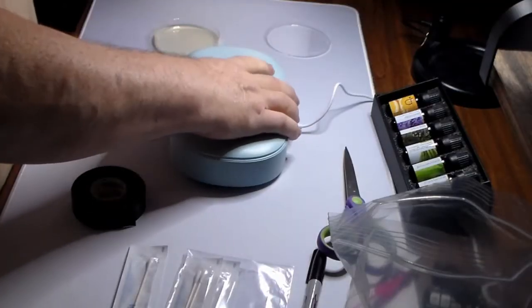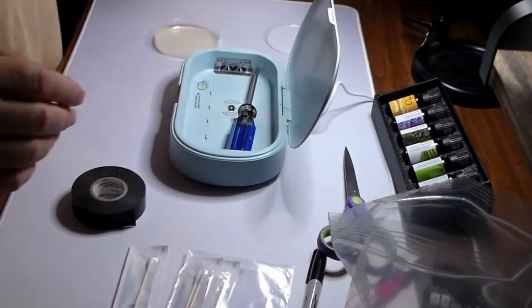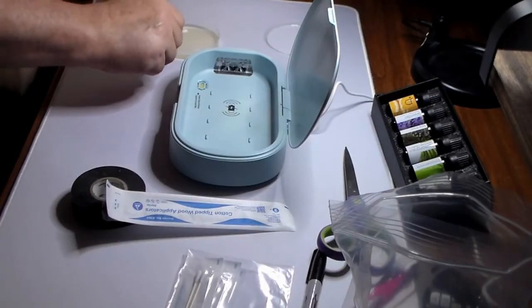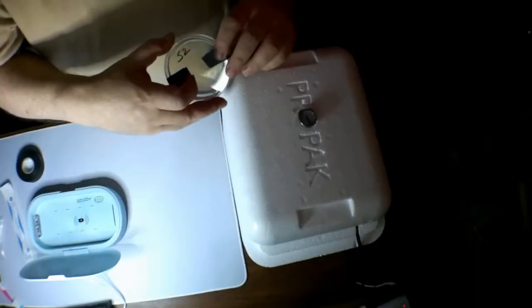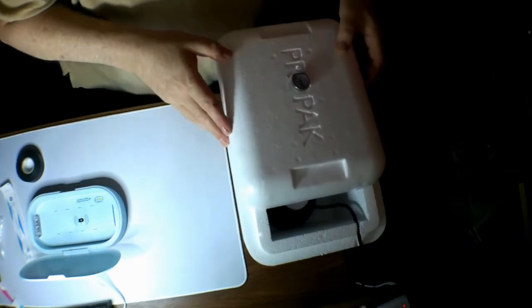So let us swab the clean screwdriver. Okay. Maybe I should have opened this first. Okay. Swabbing the handle and depositing. S2. Alright, it's going in. Okay, there is the two items.